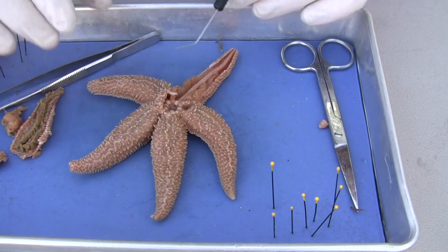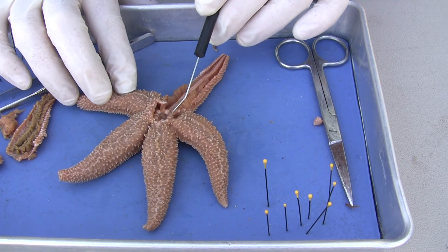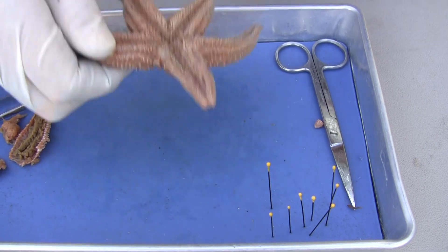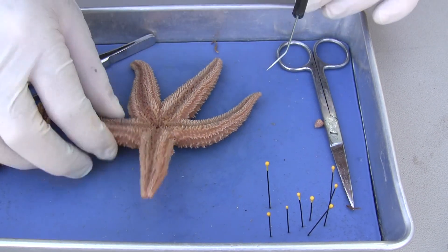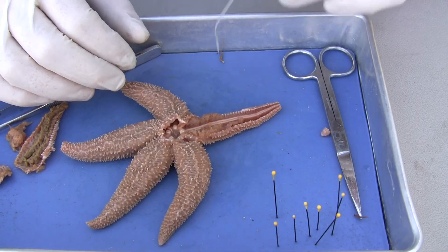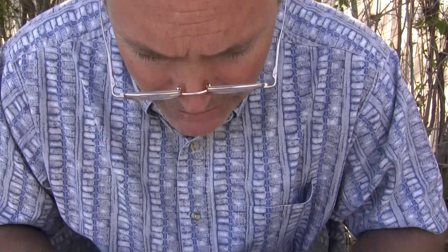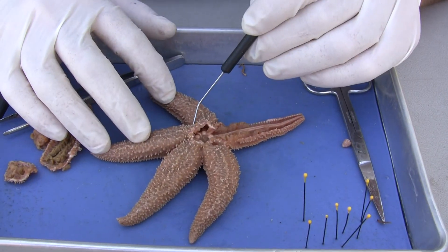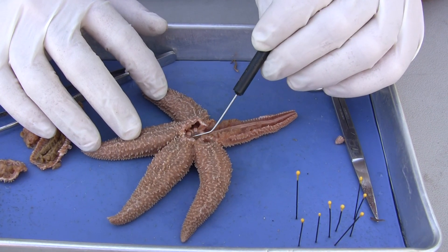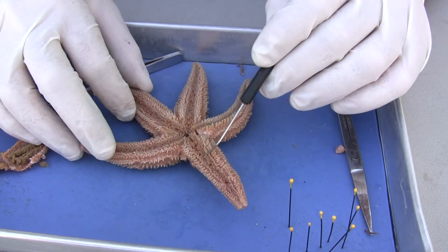Alright, so let me go through the water vascular system with you. We've got the madriporite, stone canal, ring canal, radial canal, and then tube feet. All these tube feet. One of the things you have to do in class is sing the water vascular system song. So I'm going to sing it for you. The madriporite is connected to the stone canal. The stone canal is connected to the ring canal. The ring canal is connected to the radial canal. And the radial canal is connected to the tube feet. And that's the water vascular system. That's the song you need to sing — that's your very last point on your quiz.